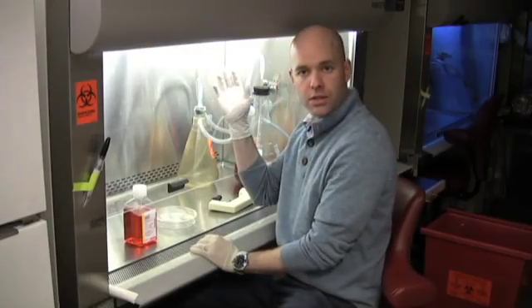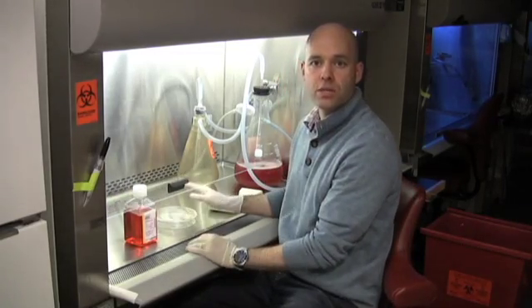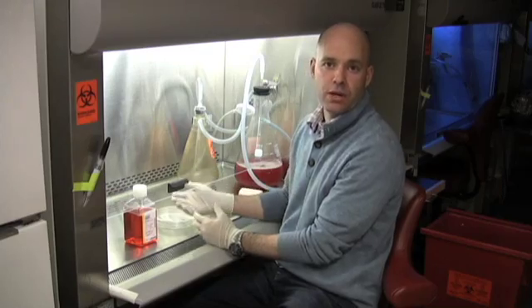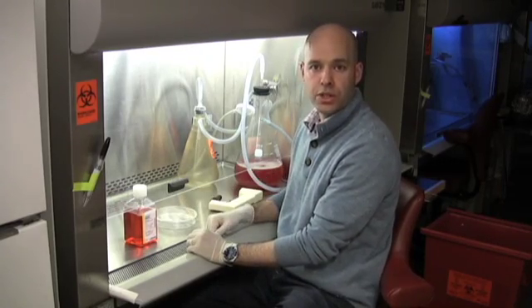So because of the strong downdraft in the hood you generally want to keep the lids on your items as long as possible and only open them temporarily when you're going into or out of a bottle or a tissue culture dish.